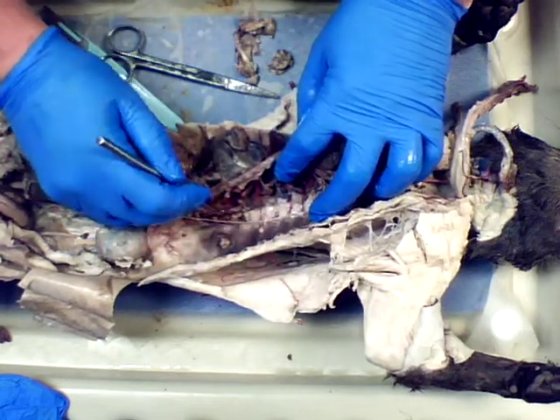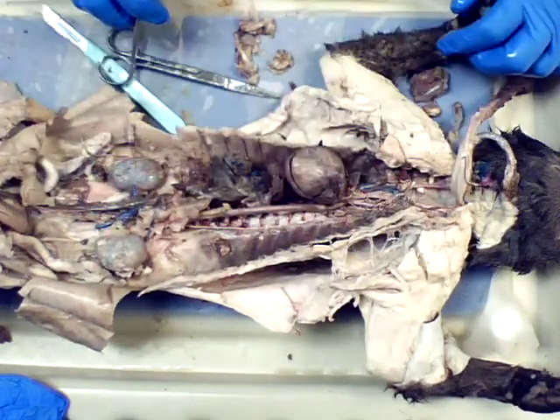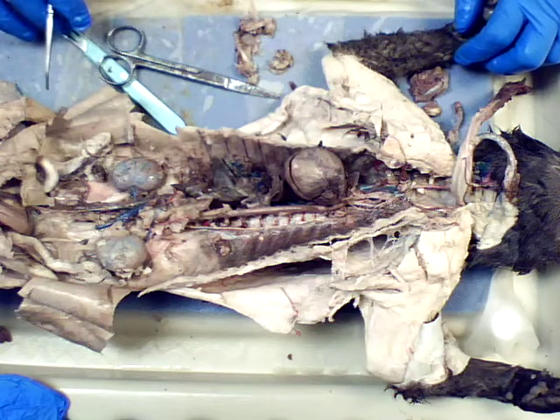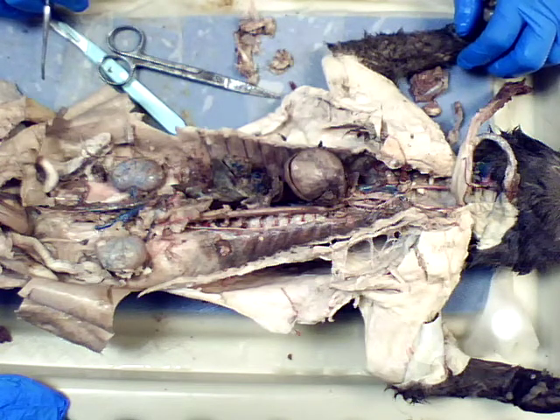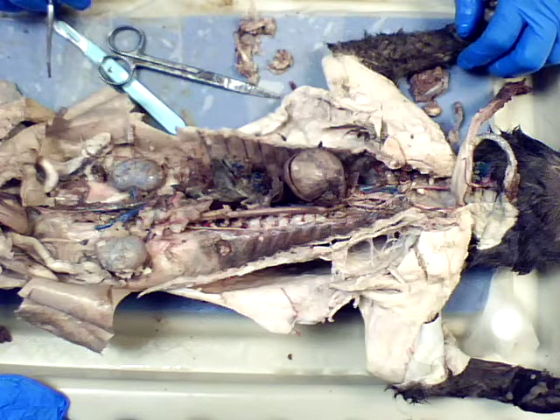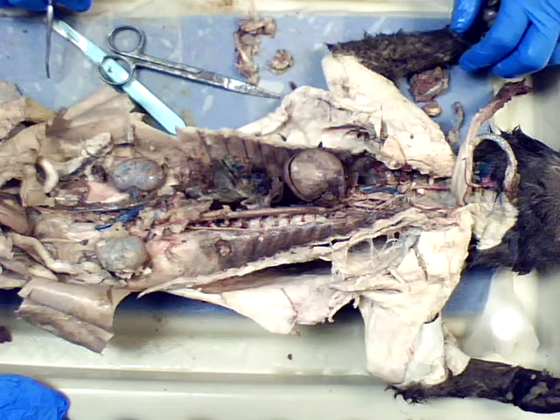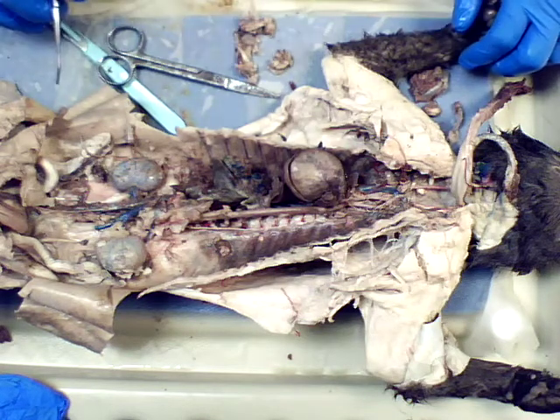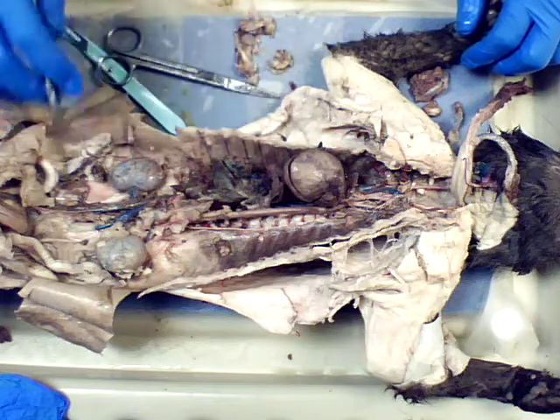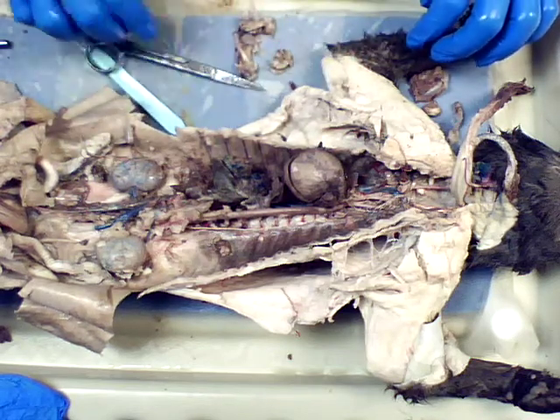Okay, that's back there, which is something we just won't be getting to. I'm not going to open up the brain. I don't have bone shears, so I can't get to it in a way that would allow me to do it justice without honestly hacking away at the cat's head. I just don't have a pair of bone shears to be able to get into there with that. Same thing with the other stuff with the back and the vertebrae. It's just going to stay where it is.